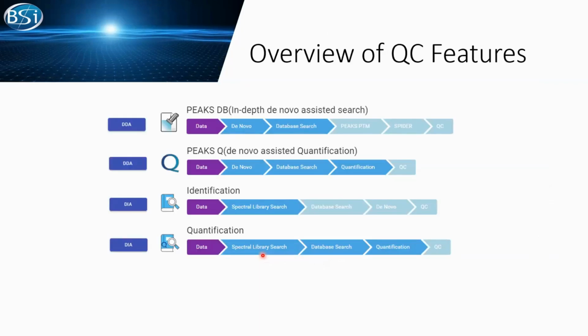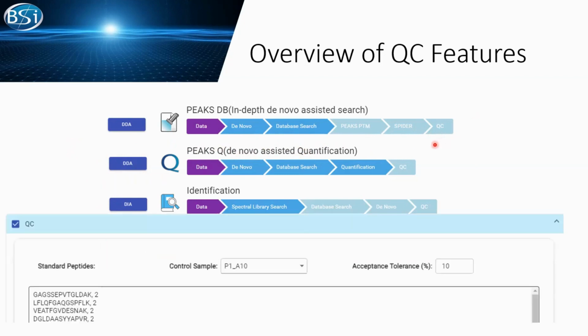So here is an overview of the QC. Our QC is fully integrated in our regular data search flow. You can see we provide DDA ID, DDA quantification, DIA ID, DIA quantification, and all these things are fully integrated. You don't have to do anything extra besides a few clicks. So here is a setup window. As you can see, you can simply check this box, and then you can start selecting your control sample.